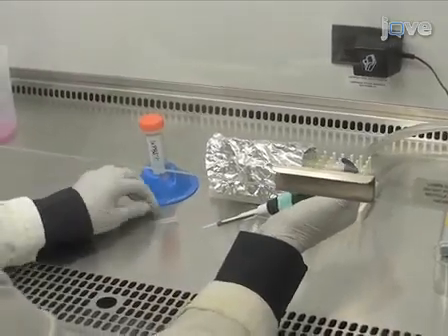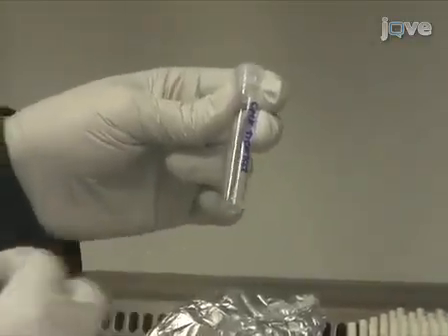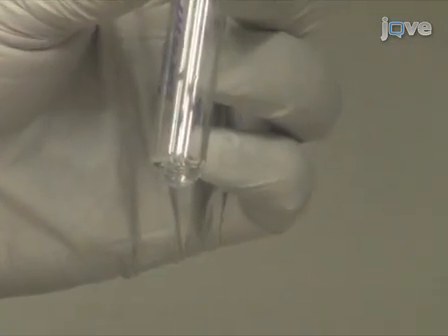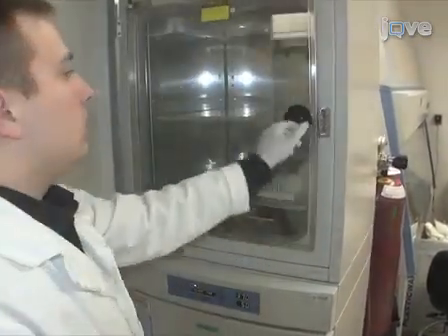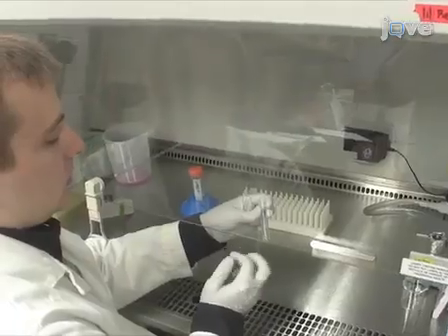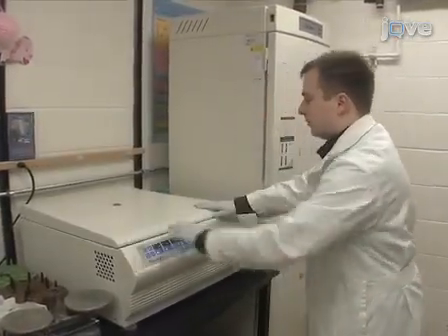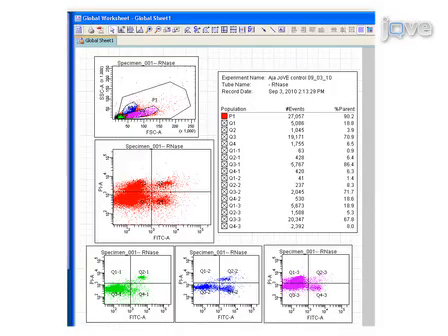During the wash, prepare a 1 to 100 dilution of RNase A in 1x PBS. Resuspend the pellet by flicking the tubes and add 16 microliters of the diluted RNase A solution to give a final concentration of 50 micrograms per milliliter. Then, incubate the samples for 15 minutes at 37 degrees Celsius. Next, wash the cells in 1 milliliter of 1x PBS and mix gently by flicking. Then centrifuge the tubes at 425 g for 8 minutes at 4 degrees Celsius. The samples are now ready to be analyzed. Alternatively, the samples can be used for subsequent staining steps if the Annexin PI staining is being performed in parallel with other procedures.